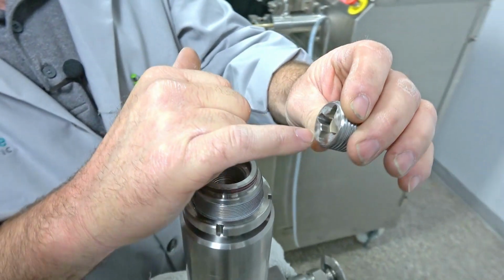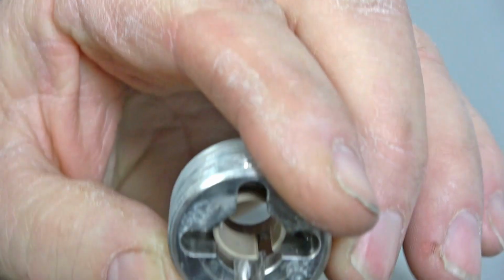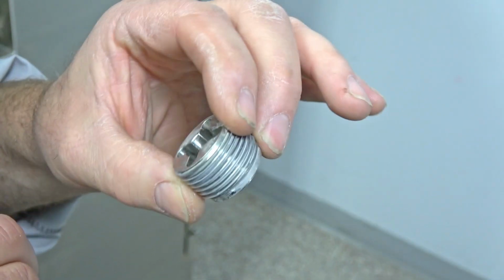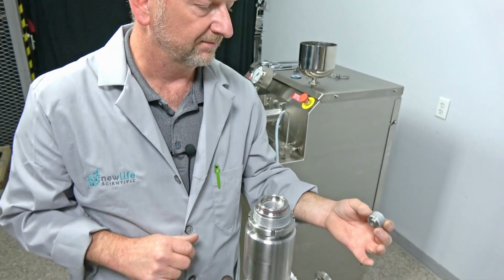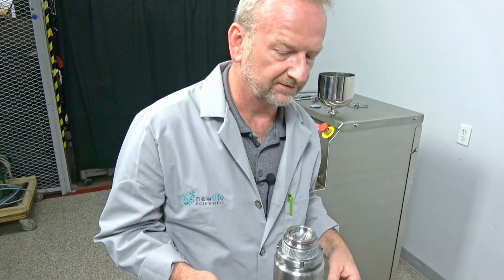And there's one piece in there. It's a split collar, but again, that usually lasts a long time. Now, if you're doing your yearly service, that would be included in just a yearly service to replace. So that one I don't mess with unless it really looks bad or I'm doing a yearly service on it.